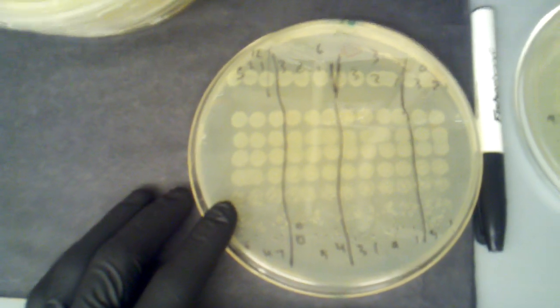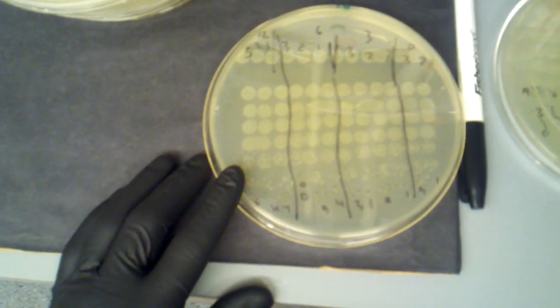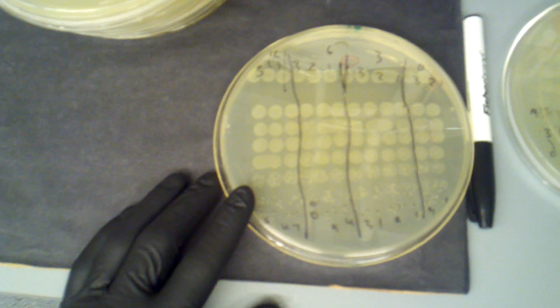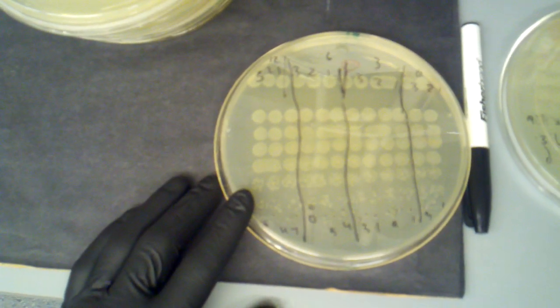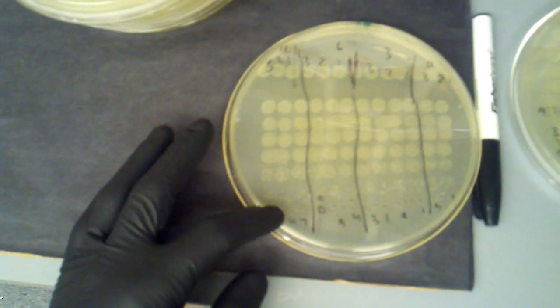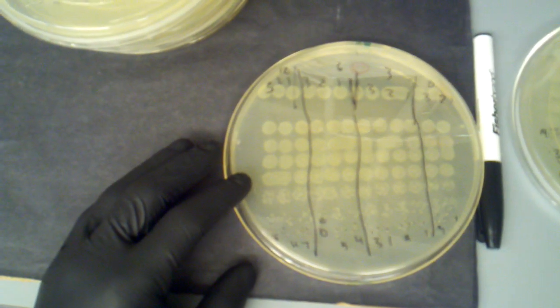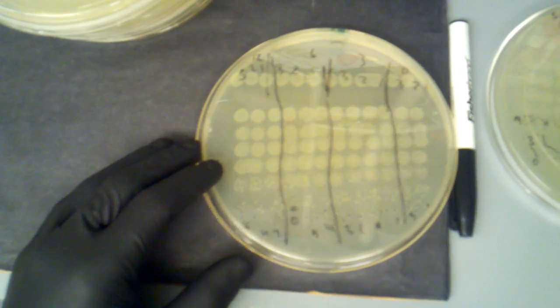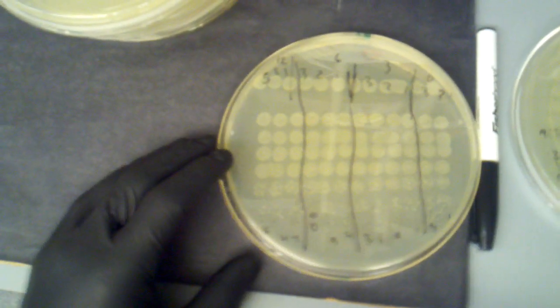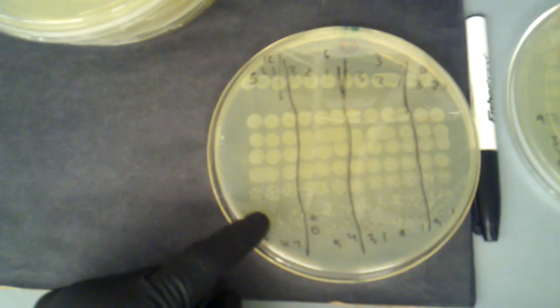Generally you want to be able to count around 25-ish is a good number. I usually just count between 1 and 30 or 40, and I just count multiple dilutions if I can, and then just either pick the best number, or if I'm confident in 2 numbers, then I'll just average them out or something like that. But I'm always about more data. So a couple other quick notes.